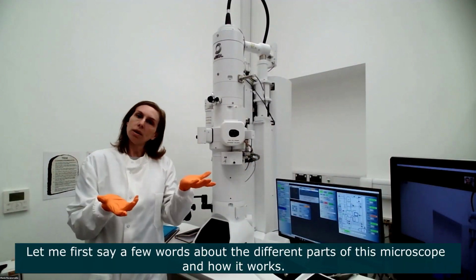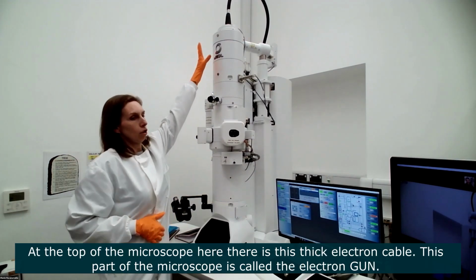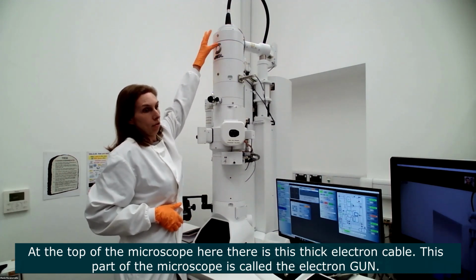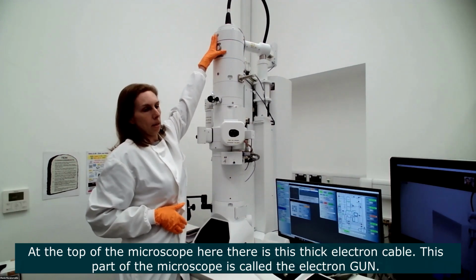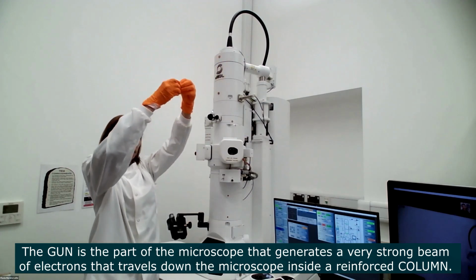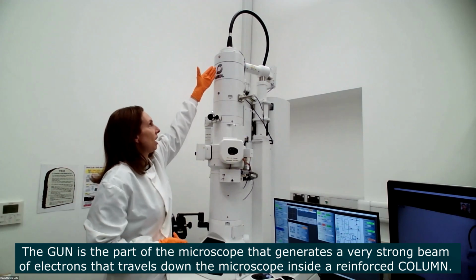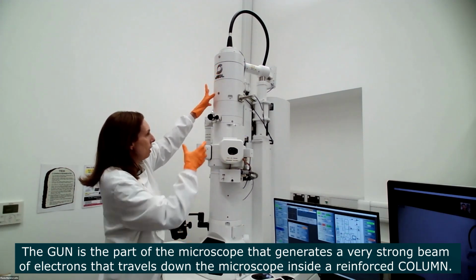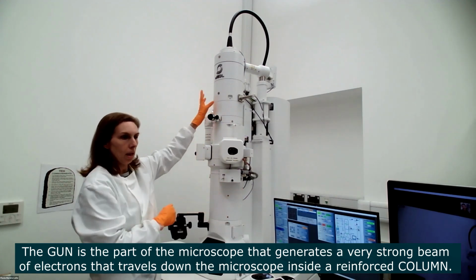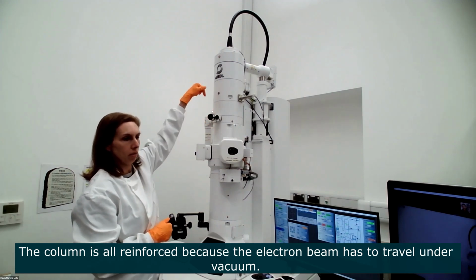Just to say a few words about the different parts of this microscope and how it works. At the top of the microscope right here, you can see this big electric cable going onto it. At this part of the microscope here, there's an electron gun. This is a part of the microscope that generates a very, very strong beam of electrons. The beam of electrons travels down the microscope inside this reinforced bit here called a column. The column is all reinforced, and you don't see the beam traveling in the microscope. The beam is all inside the column.